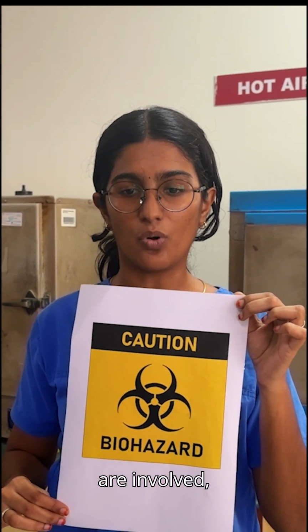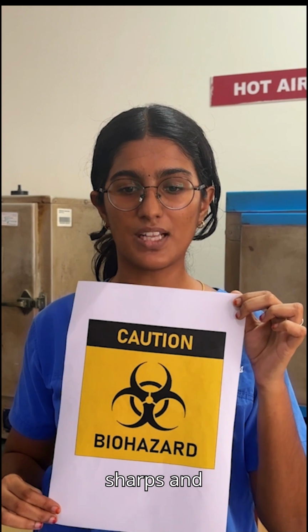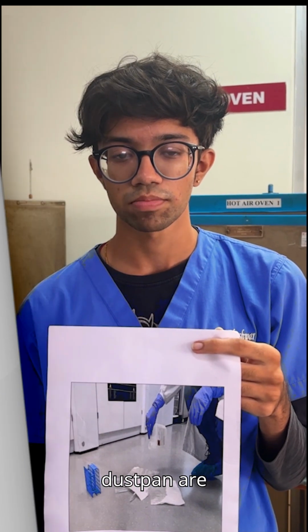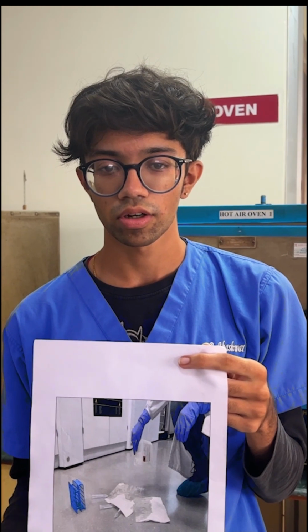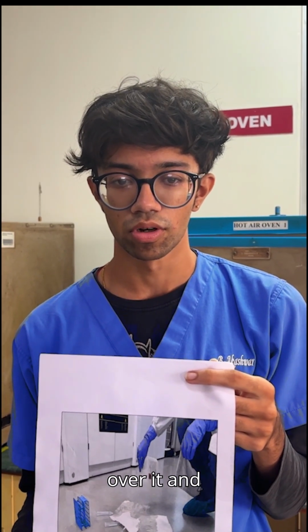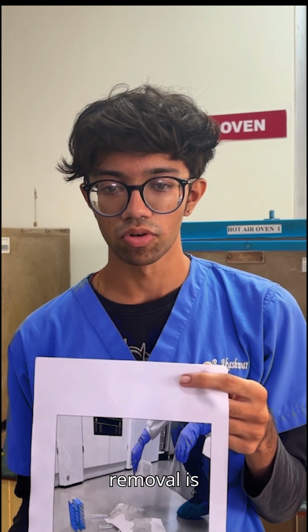When sharps are involved, use forceps to pick up the sharps and discard these items in a puncture-proof container, which should have a biohazard symbol. For cleaning sharps, forceps, a broom and dustpan are needed. Alternatively, chlorine granules can be sprinkled on the spill first, and then the paper should be put over it. Wait for 5 minutes, then removal is done.